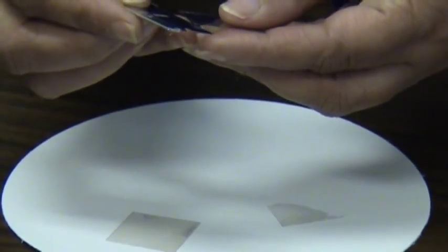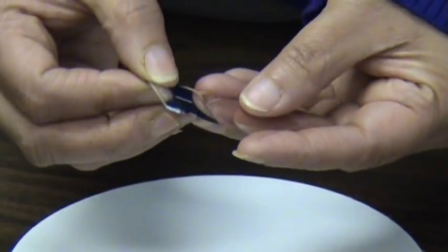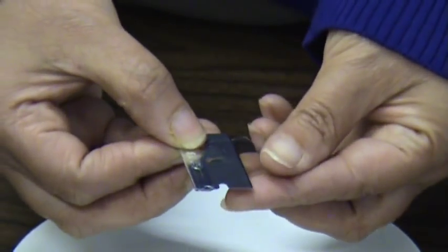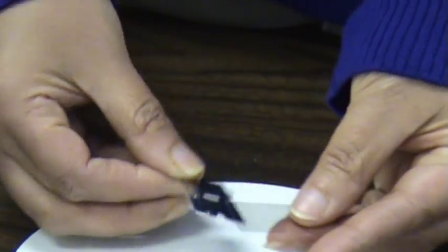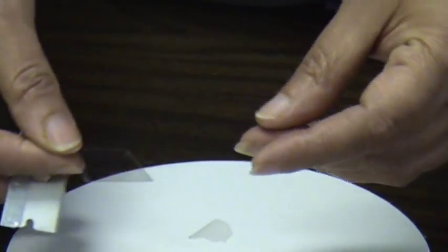This should yield two fresh surfaces. Repeated cleavings of a single piece can be done so that with practice, you could obtain quite a few fresh substrates from a single substrate.